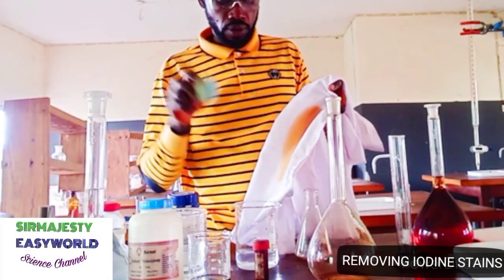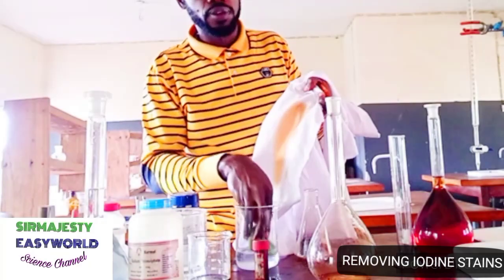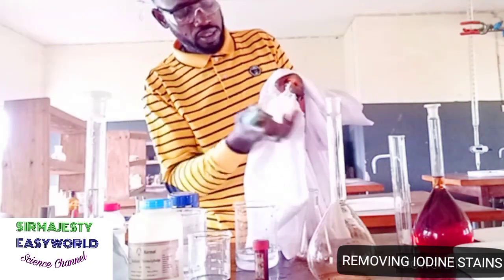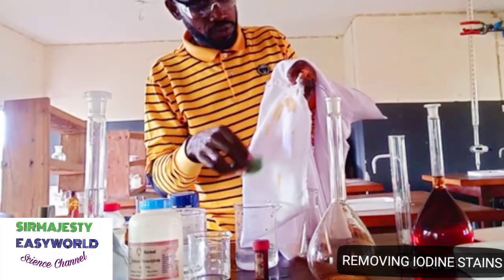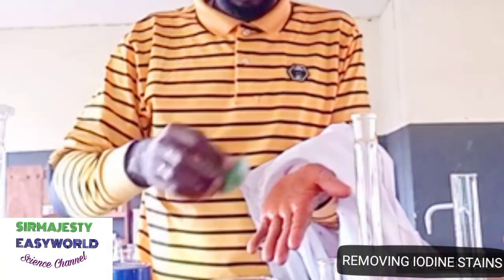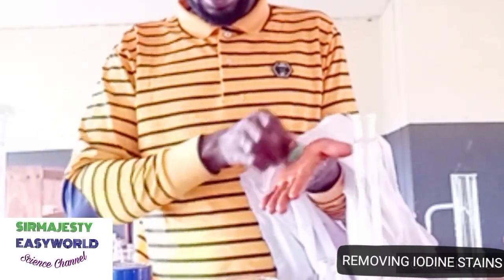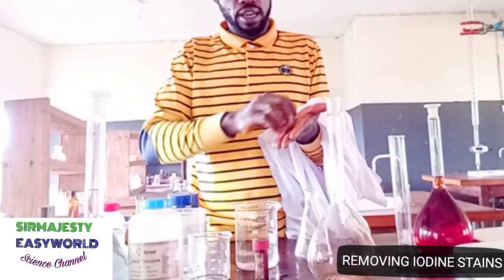But right now, if I want to remove it, I will just soak this into this solution of sodium thiosulfate. You see, it's cleaning it just like paper. Remember, I'm using an ordinary hand. It's not cleaning. But with this solution of sodium thiosulfate, it works magic. Just rub off the mess. It becomes very neat again. It's allowing it to react with the iodine, converting it to iodide. So if you have done this, what it means is that you have returned it from elemental iodine to iodide ion.